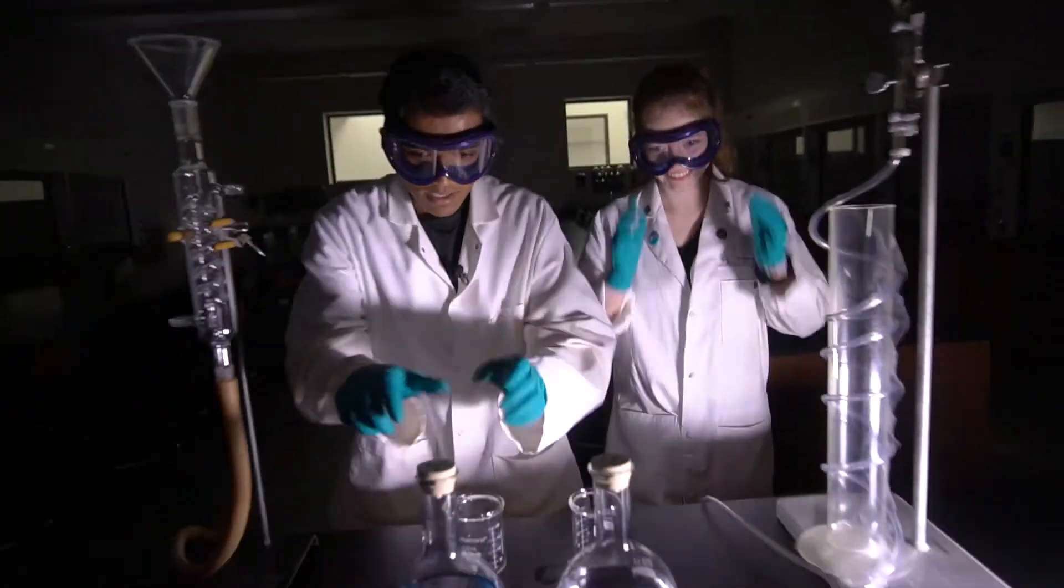Now we're ready to begin the demonstration. Goggles, lights, and now we'll pour.